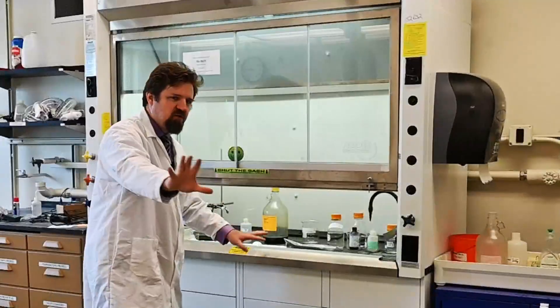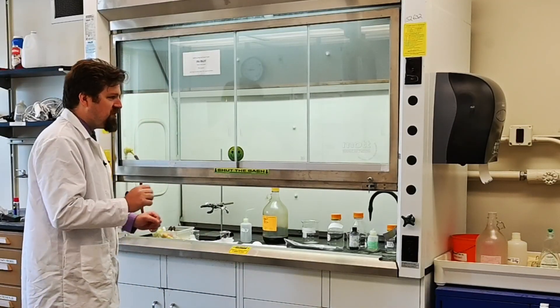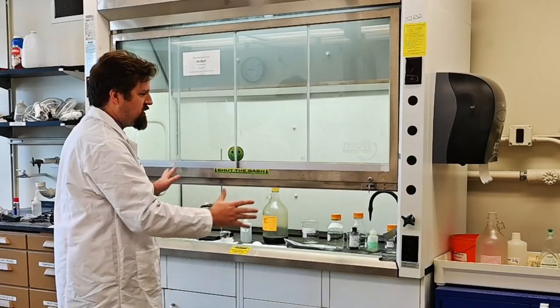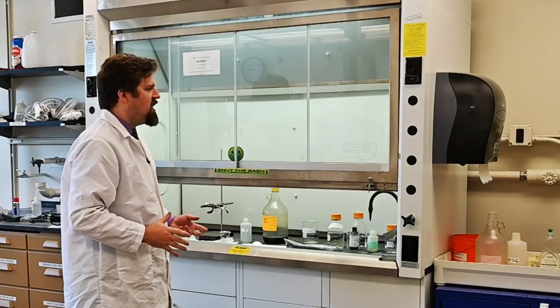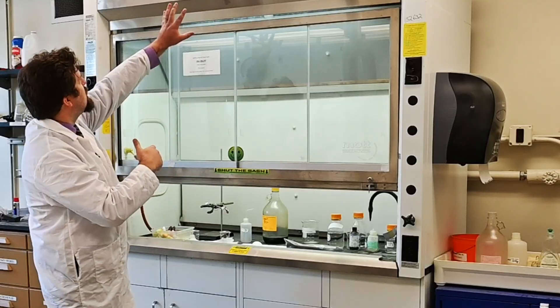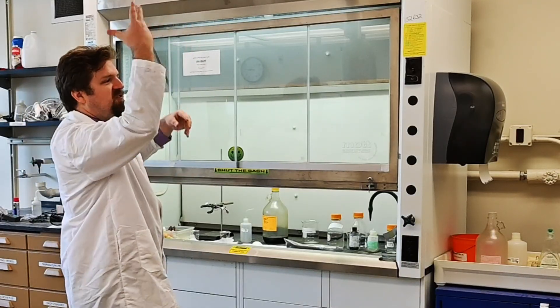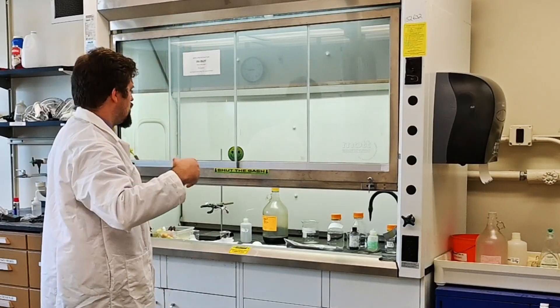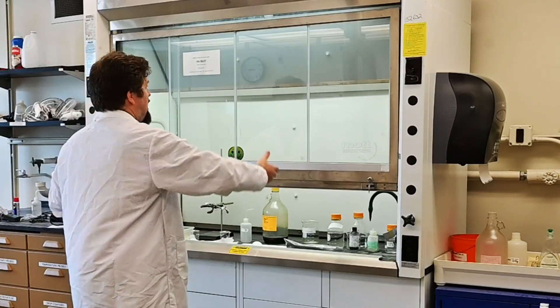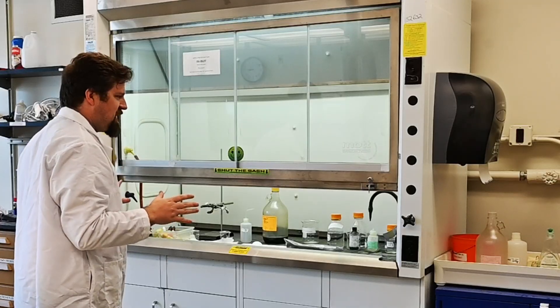So what do you do if you have a volatile liquid? One thing you can use is this monstrosity here called a fume hood. A fume hood is a self-contained box, and if you can see up top, it has a pipe and then a fan on the roof that draws the air up and takes it to be filtered and dispersed outside.